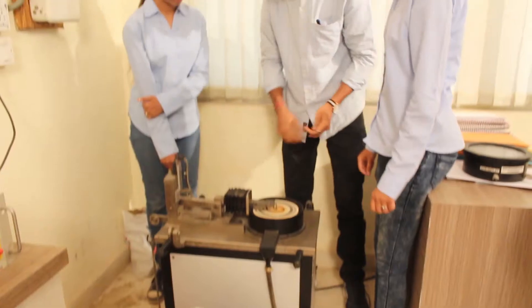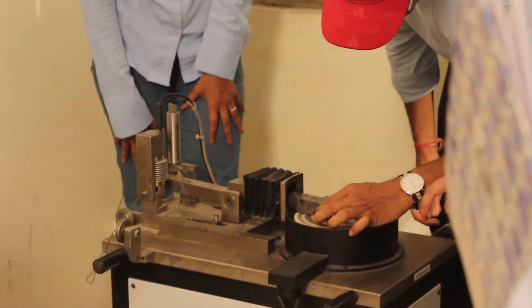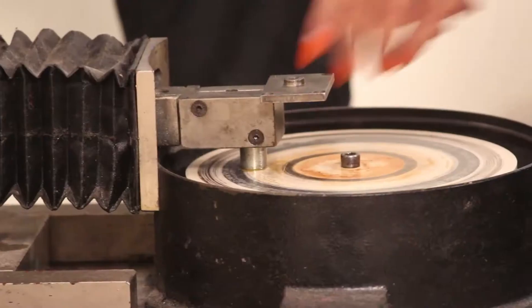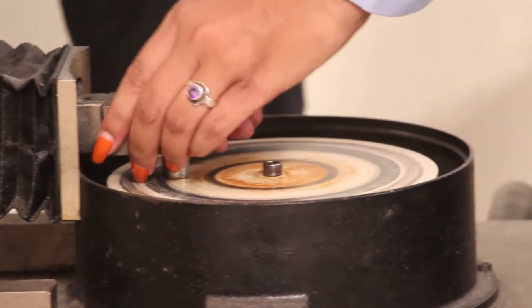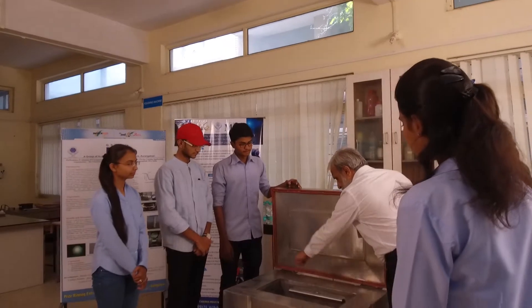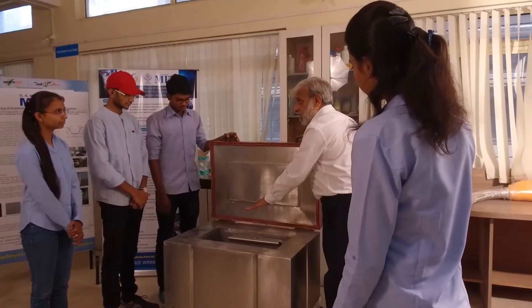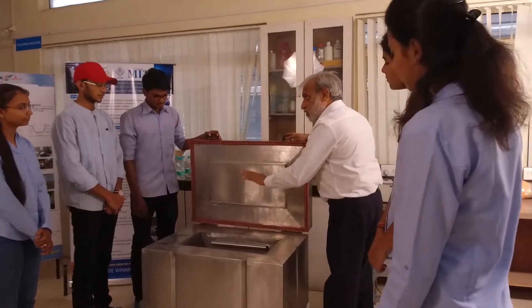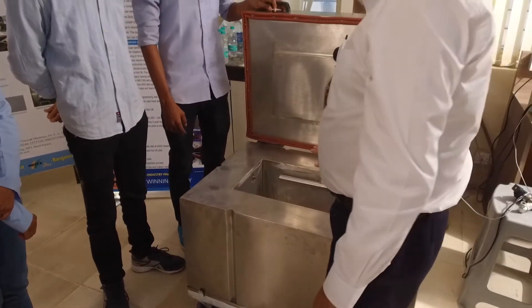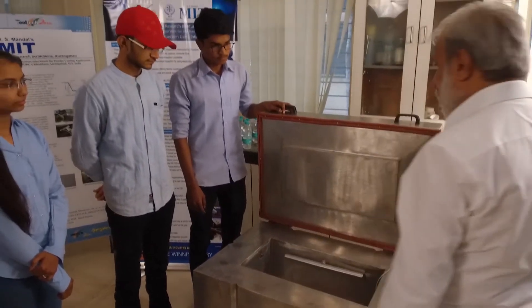Materials lab is equipped with wear testing facility and characterization equipment. It is also equipped with cryogenic processing facility based on in-house technology to process materials like tools and dies, tungsten carbide tools, polymers and polymer composites.